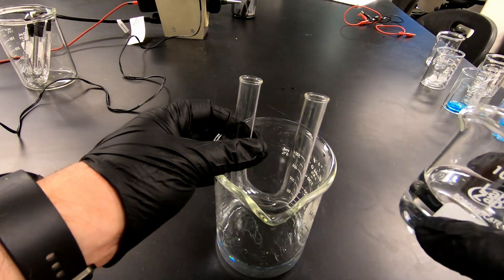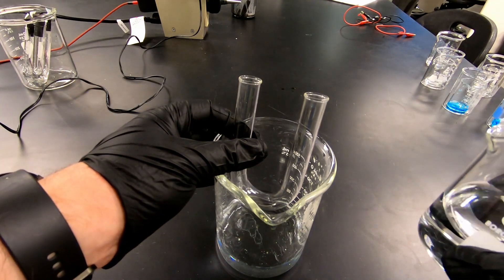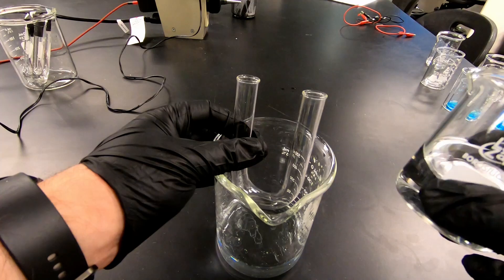Full disclosure, I've already built my salt bridges. You can see them off to the left actually. So I'm just doing this with DI just to show you.